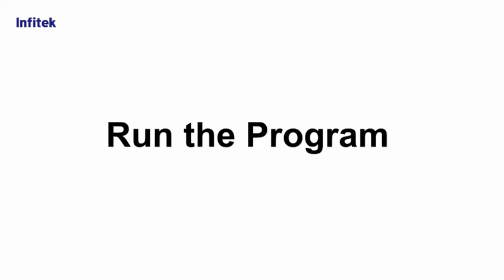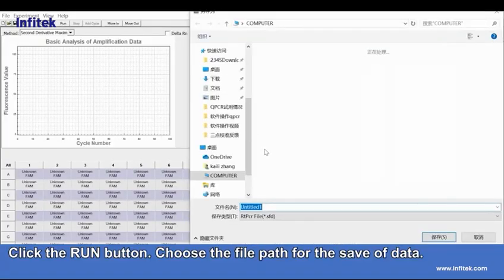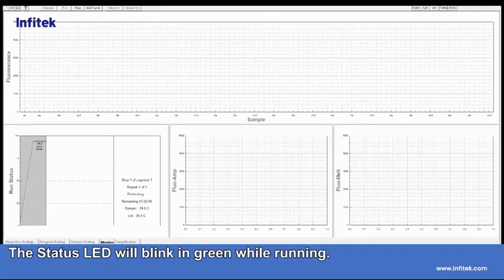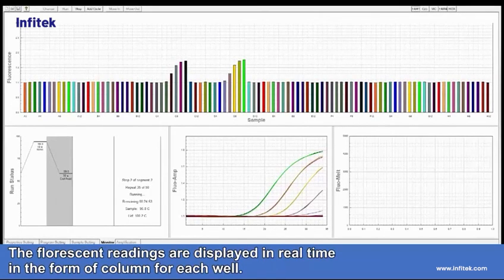Run the program. Click the Run button. Choose the file path for the save of the data. The analyzer will run the program. The status LED will blink in green while running. The fluorescent readings are displayed in real time in the form of columns for each well.